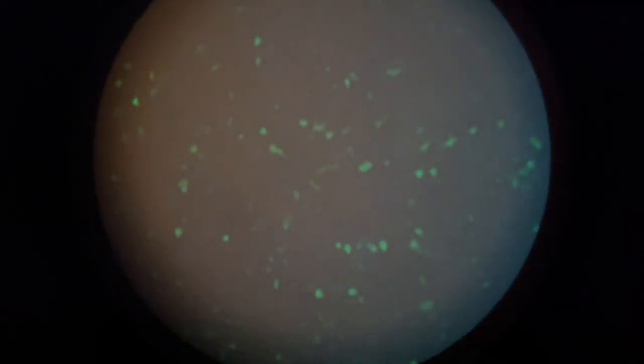If I turn on this light, you can see all the cells. It's actually pretty confluent. I'm going to turn that off, and all you see is the fluorescing cells. Just that easy. Really straightforward. I can watch them. I can look at the percentage of cells that are glowing.